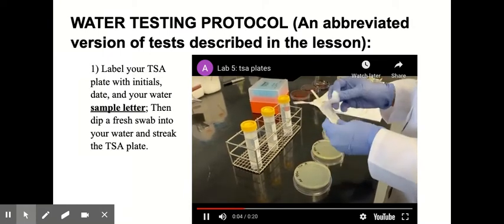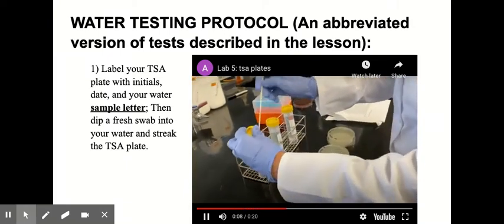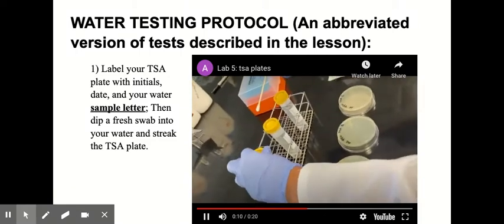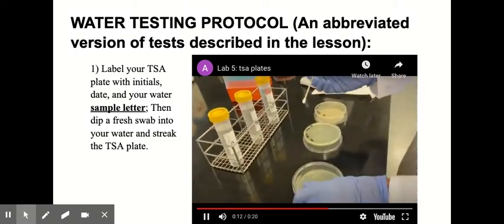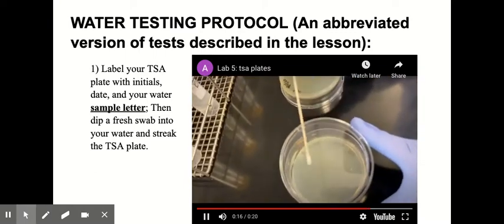Remember I assigned each water sample A, B, or C. So then you would just dip a fresh swab into the water sample, and using sterile technique, carefully swab that onto the TSA plate.